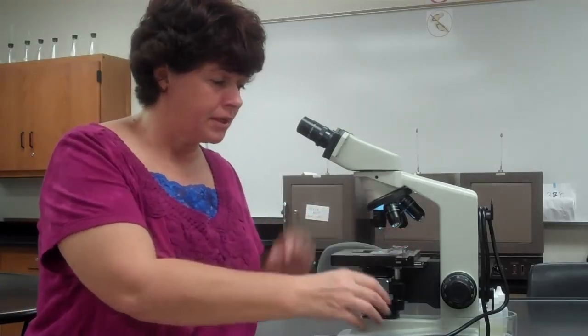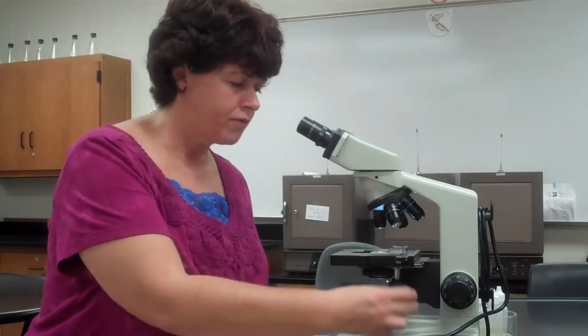Now, as we get started, let's think a little bit back about what we've done. So we've made some stains, and remember that I had you draw circles to where you're going to put your stain, where you're going to put your smear. That was to make sure that when you look under the microscope, you're looking in the right place. When you look at this, you may feel like there's nothing on the slide, looking at it with the naked eye. Remember, bacteria are so small, you may not see your smear with the naked eye. So drawing that circle was so that at least when you put it on the microscope, you have somewhere to shoot for. So when we put it on the microscope, you put it in that clip, you put it over the light source. So if it's not centered, you're going to move it over the light source.